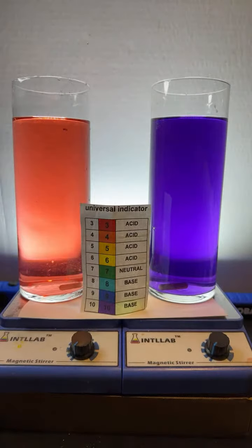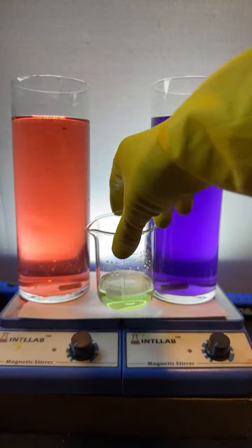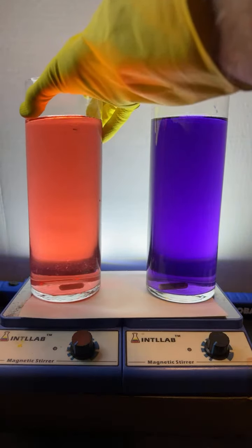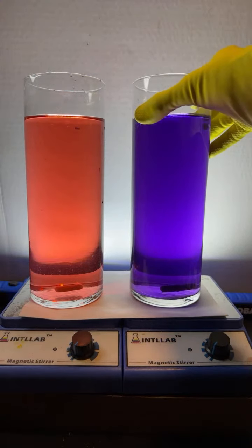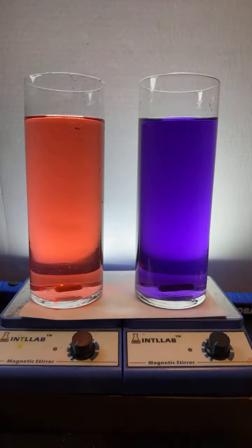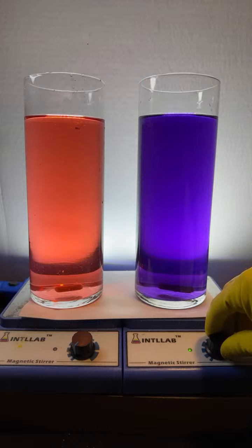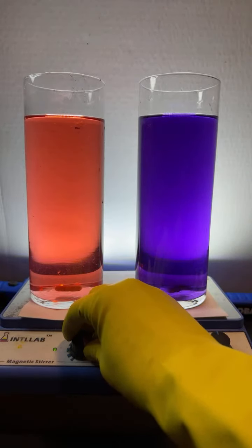Thank you there, Nathan. I appreciate the kind words. What acid and base do I have? Asked Finn Jones. So the acid that I'm adding is hydrochloric acid, 20% by weight. The base that I'm adding is, did I say hydrochloric acid 20% by weight? Yeah, and the base I'm adding is 20% by weight sodium hydroxide. So that's what I'm adding. The indicator that I'm adding is universal indicator. No, they're strong acids, Modern Orca.